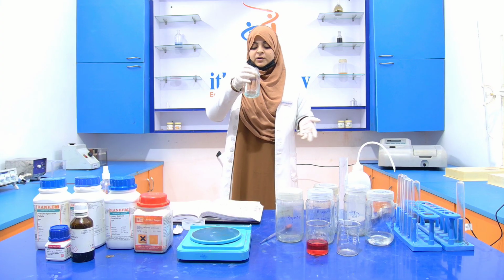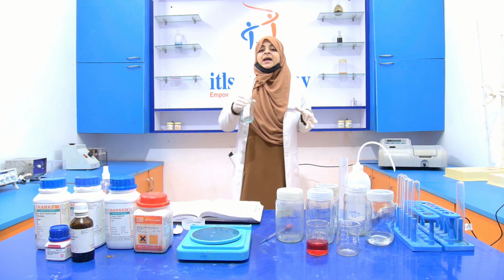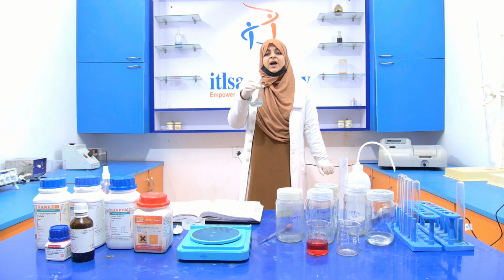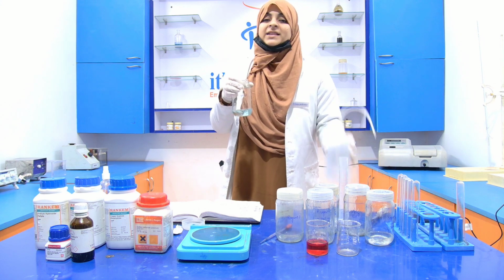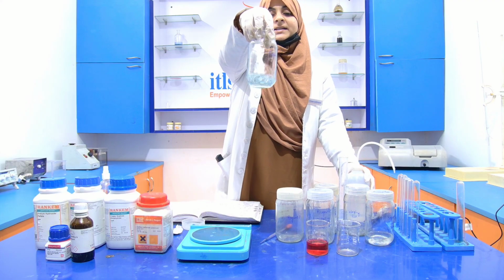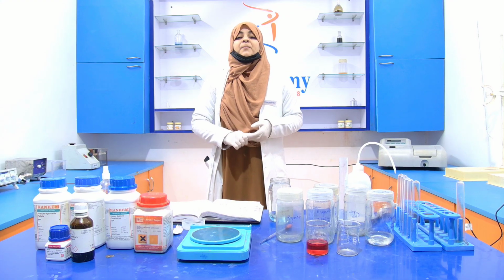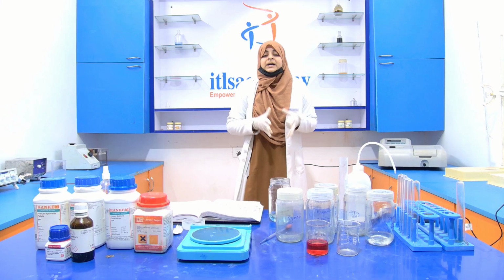What you have to do is, first of all, halve the volume of the solvent and dissolve the chemical into the first half of the solvent. Then after that you add the remaining solvent. Here I use distilled water as the solvent. Now you can see that it is completely dissolved. I am still not going to add the remaining 50 ml of distilled water because I have to add one more chemical into it.